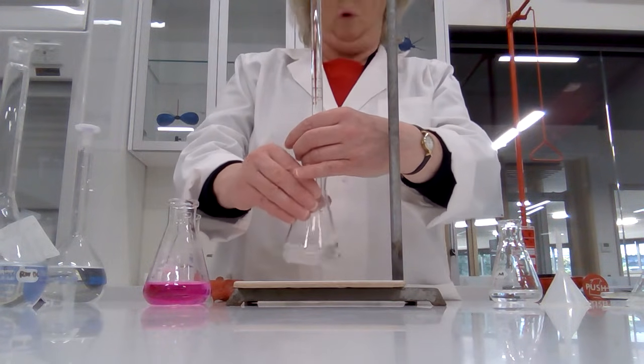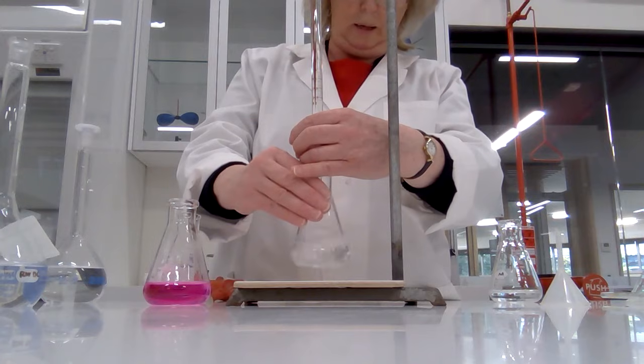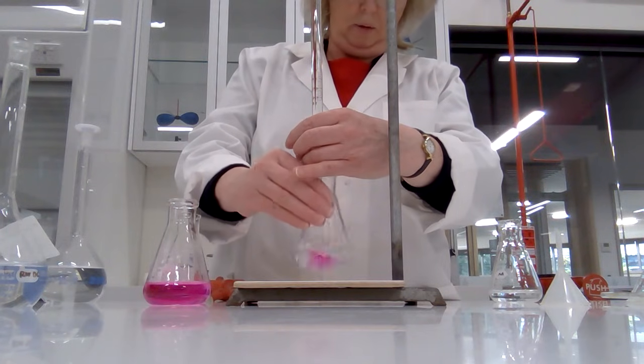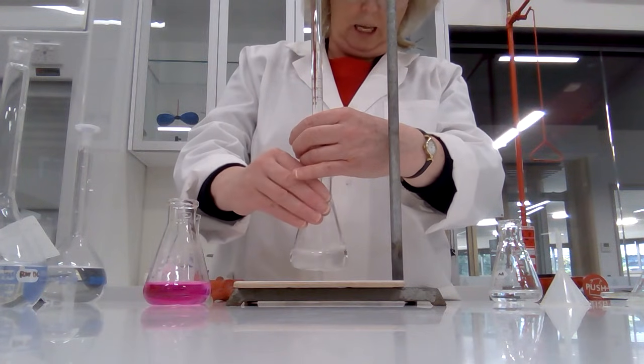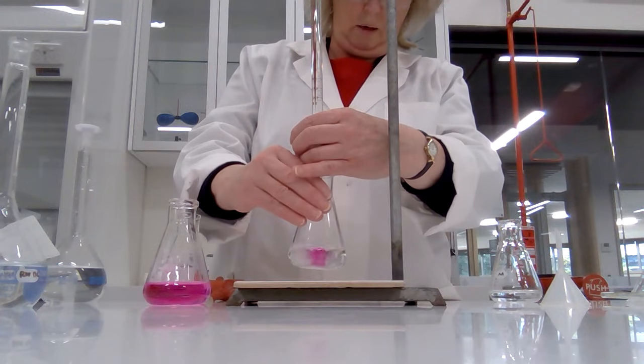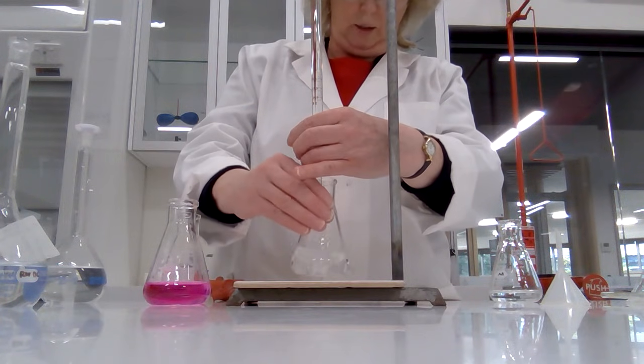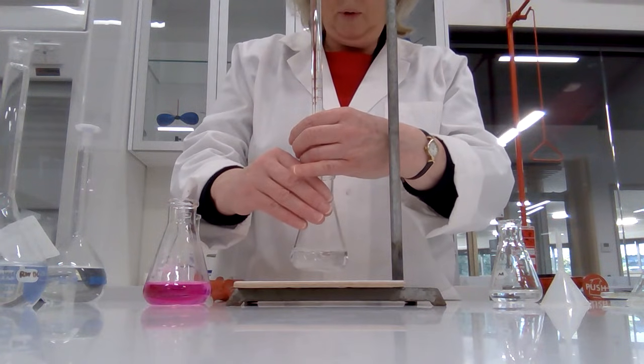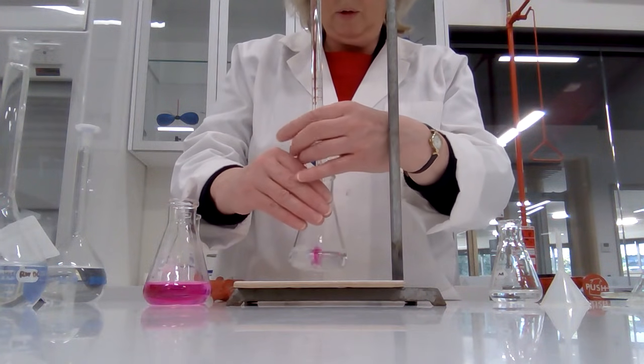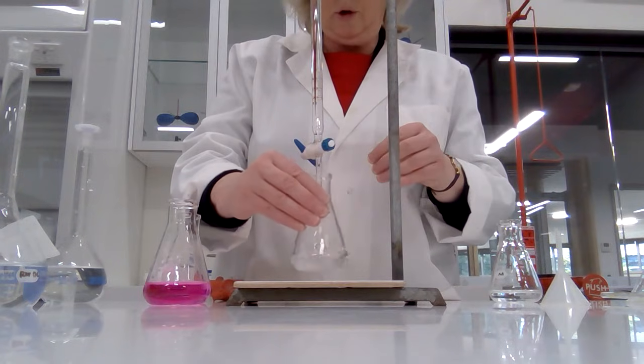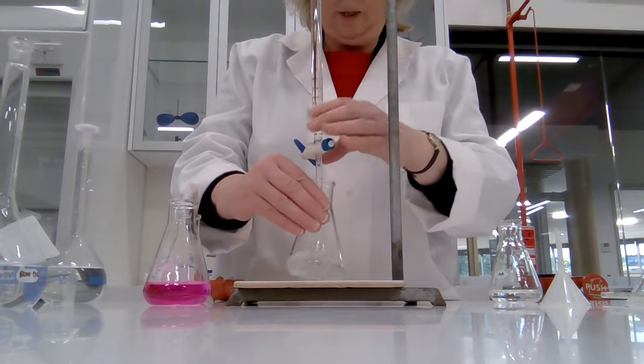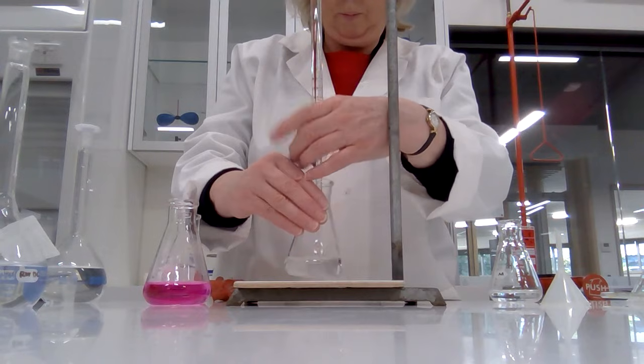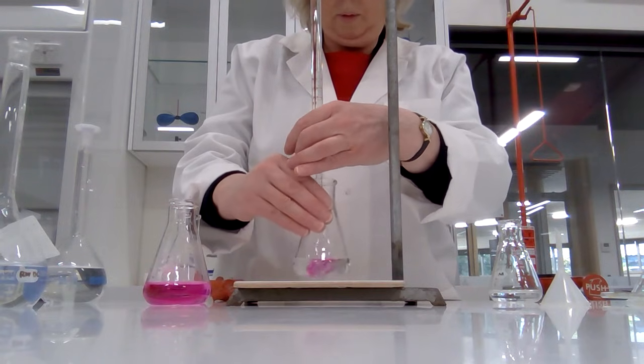Right, we're almost up to 19 milliliters and we're expecting 20. So let's just get it on dropwise if I can. Maybe I can't. Maybe I need more control. Drop, and another drop, and another drop.